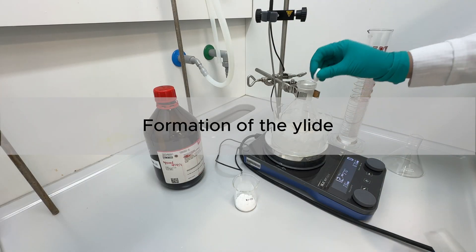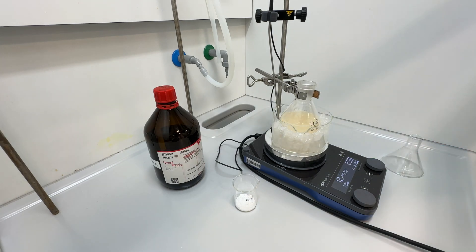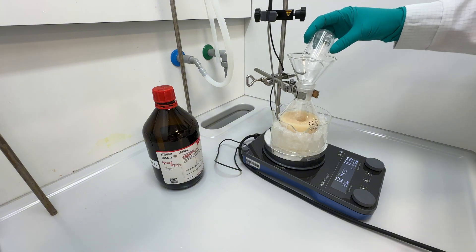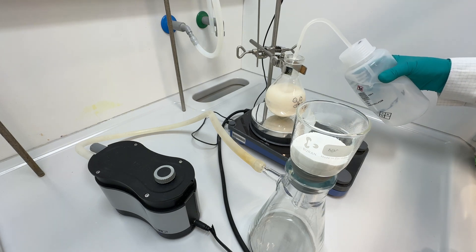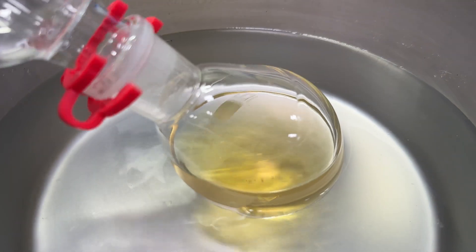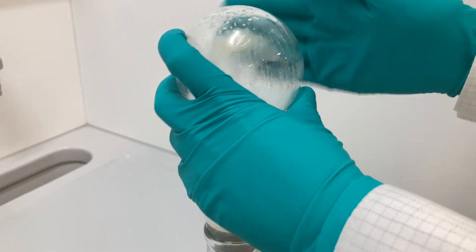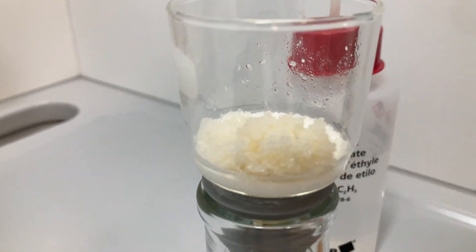Our next step was to prepare the ylide. The previously synthesised triphenylphosphonium salt was transferred into a round-bottom flask and suspended in THF. After cooling the reaction mixture to 0°C, the suspension was treated with potassium tert-butoxide, and the resulting reaction mixture was stirred at room temperature for two hours. Upon completion, the mixture was first diluted with DCM, and then filtered through a short pad of Celite to remove inorganic salts. The filtrate, containing the desired product, was dried under vacuum, and the resulting crude product was dissolved in the minimum amount of DCM. Ethyl acetate was then added slowly until the solution became turbid. The mixture was left standing at room temperature overnight. The following day, the obtained crystals were filtered and rinsed with additional ethyl acetate to afford the desired ylide as a white crystalline solid.